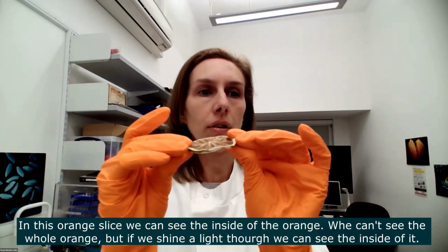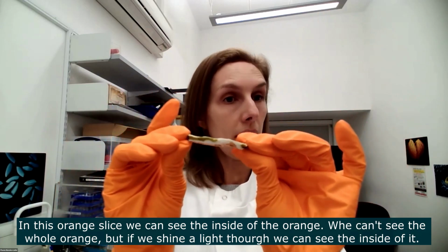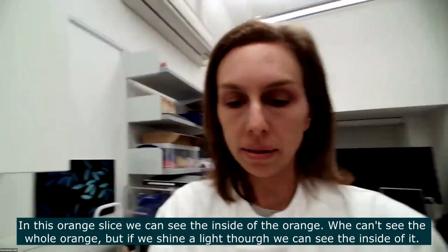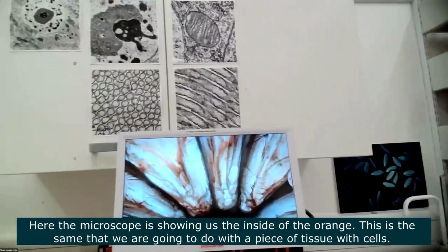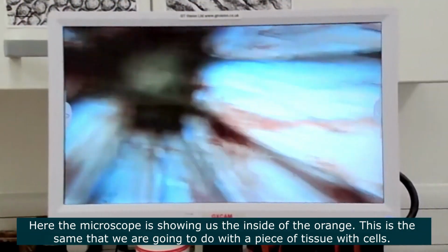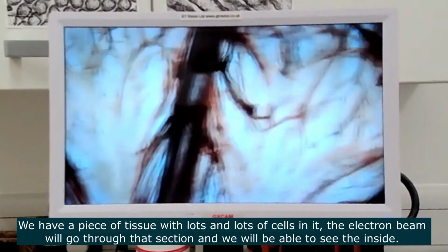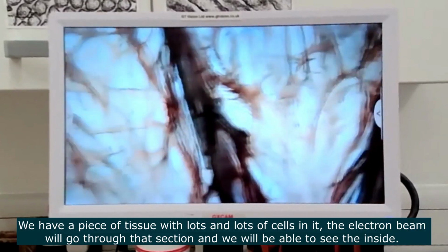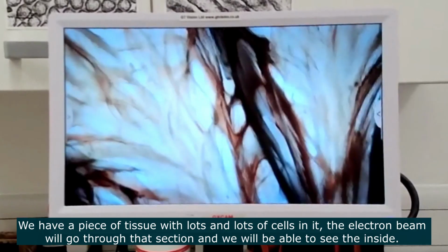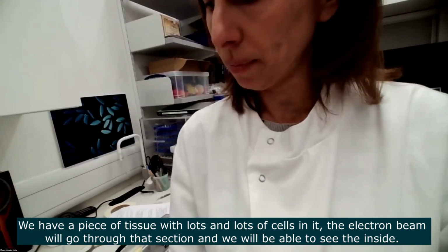In this slice of the orange, we can see the inside of the orange. So we can't see the entire orange, but if we shine a light on this slice of orange, we can see the inside of it. So here the microscope is showing the inside of the orange. That's the same that we're going to do with the tissue for the cells. We have a piece of tissue with lots and lots of cells, and we are going to look at a section of it. The electron beam is going to go through that section, and we'll be able to see the inside.